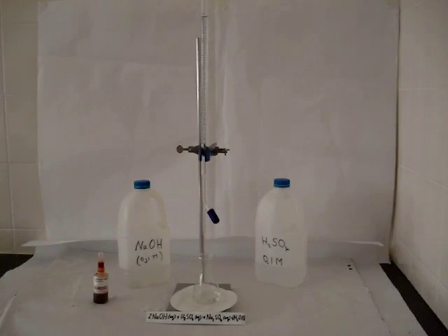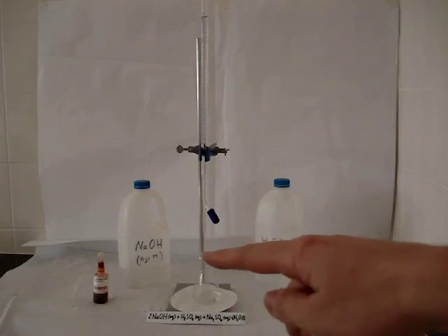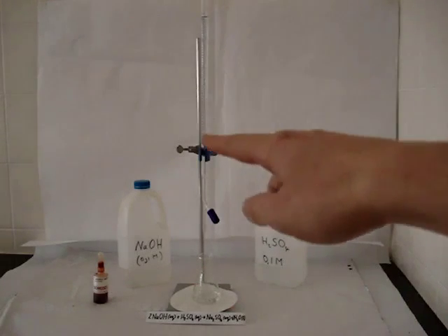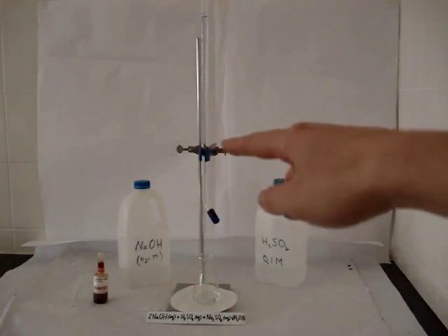We have a base in the conical flask over here, and the base that we're using is called sodium hydroxide. Inside the burette, clamped here to a retort stand, is an acid, sulfuric acid.